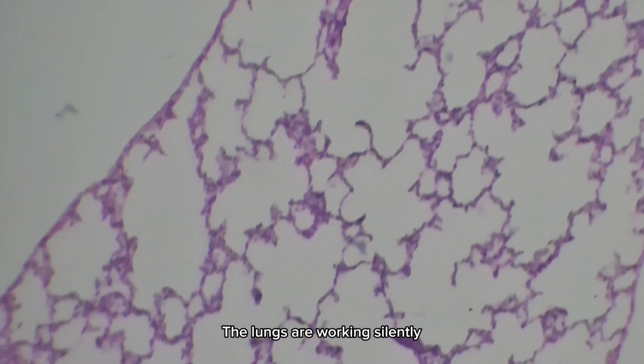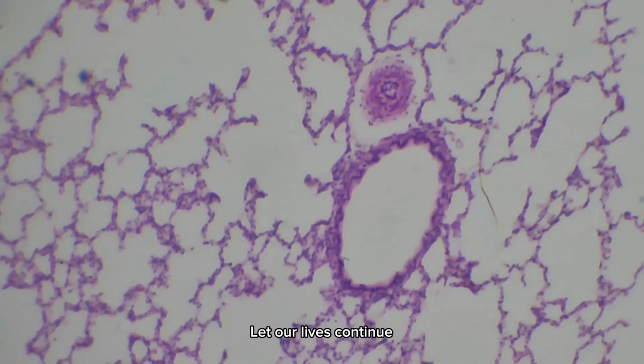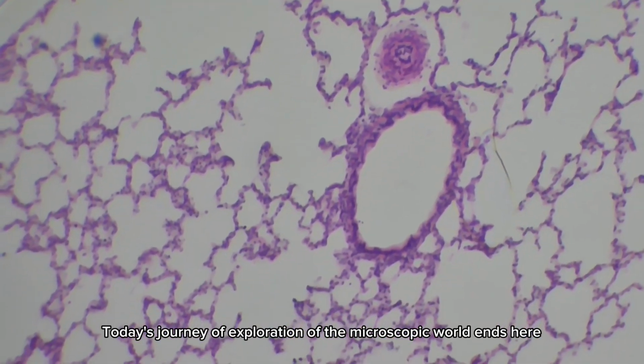Every breath, the lungs are working silently, providing us with fresh oxygen. Let our lives continue. Today's journey of exploration of the microscopic world ends here.